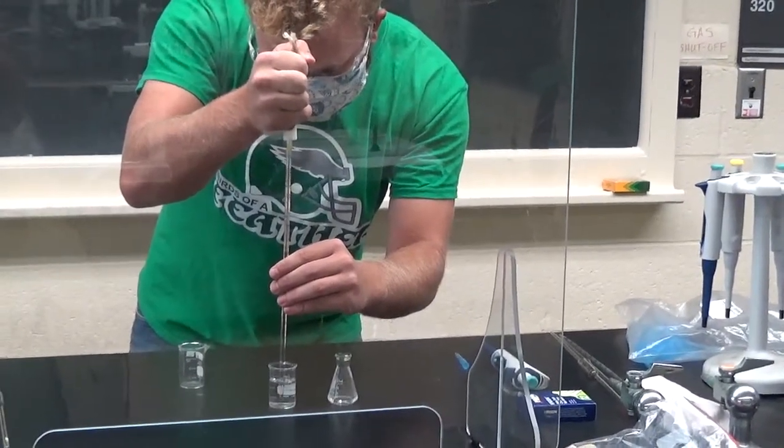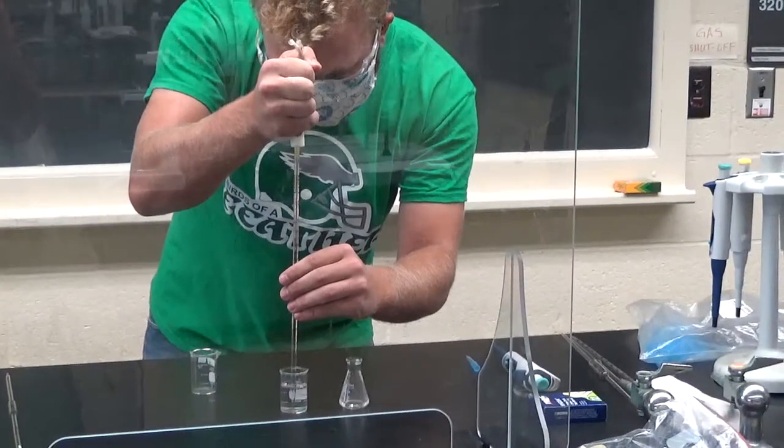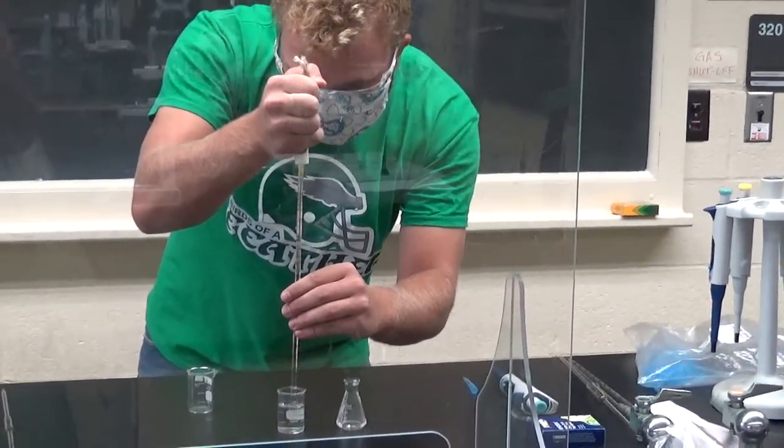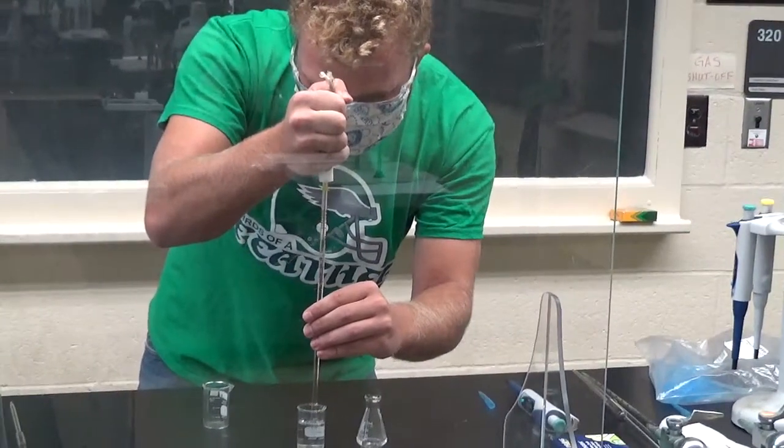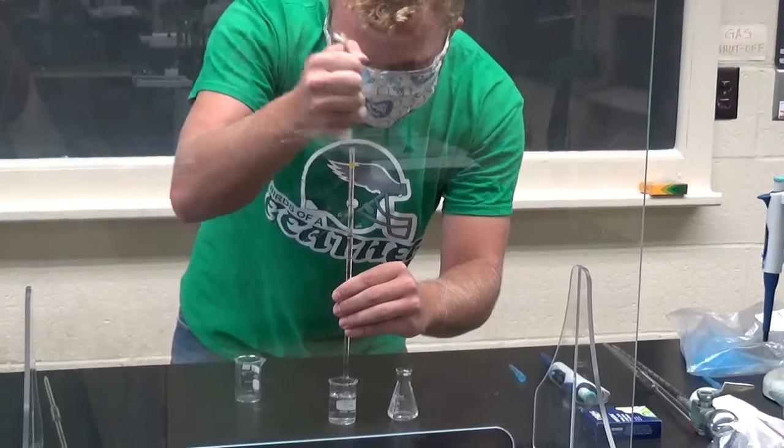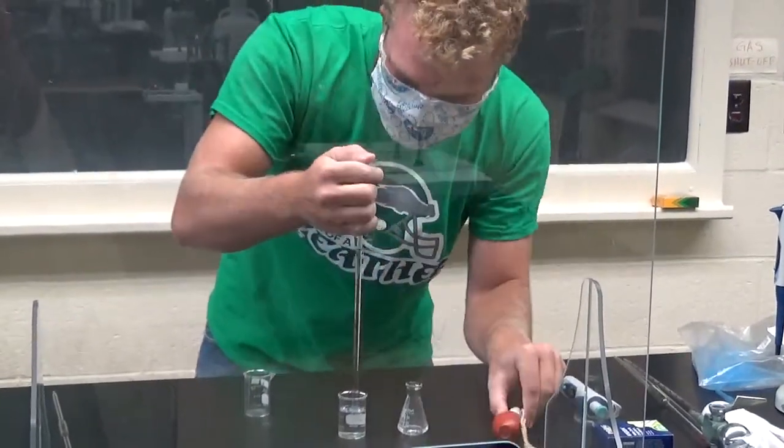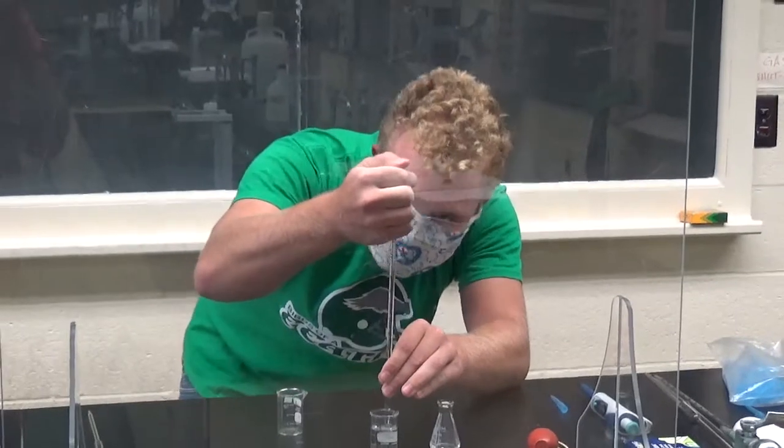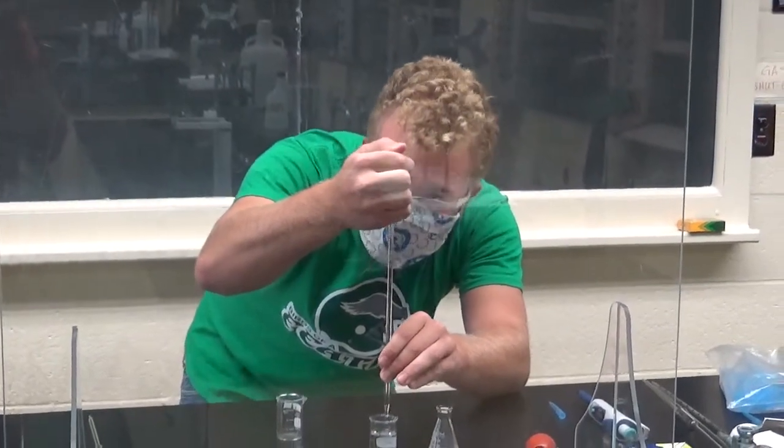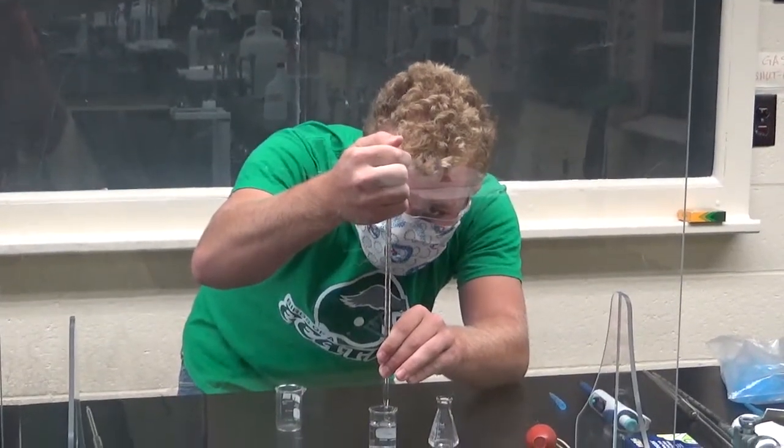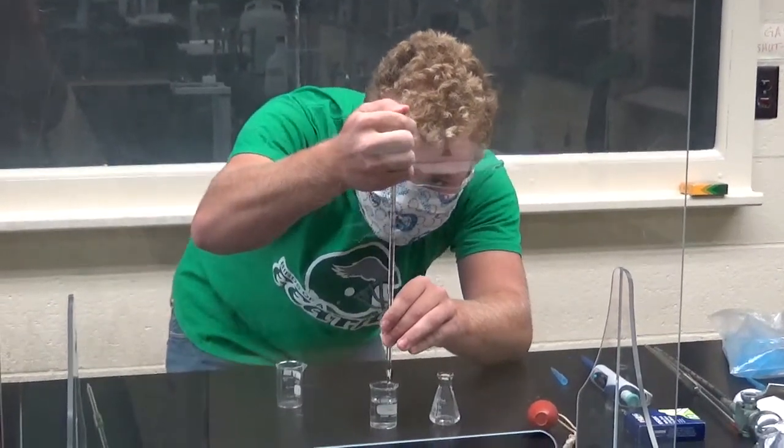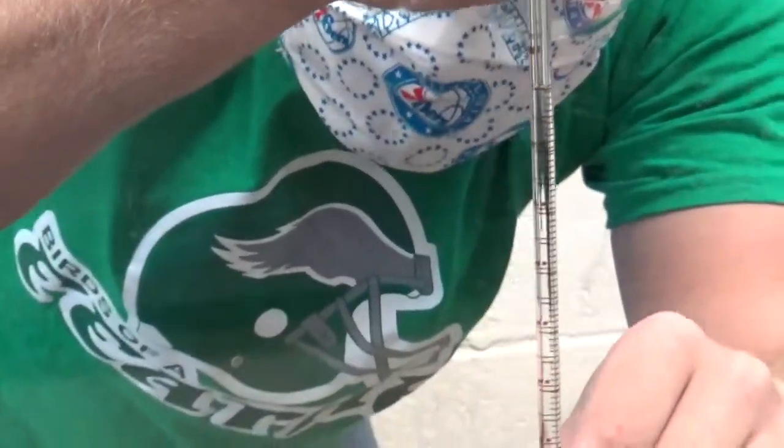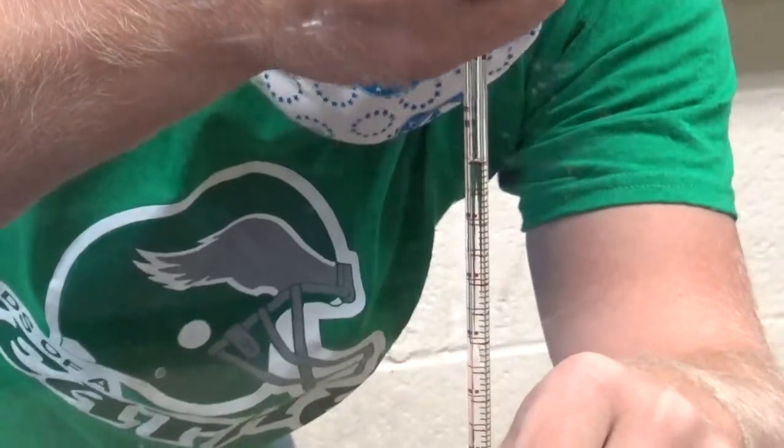Now, do you have to go to the zero mark on this one? Like, say you want 0.5 milliliters, could you use it for this? I think going to the zero mark gives you the best options. You want to always go to the zero mark. Before you do anything. Once you hit the zero mark, you can see there, I hit that zero mark. The meniscus, right on the bottom of the meniscus, right on the zero.